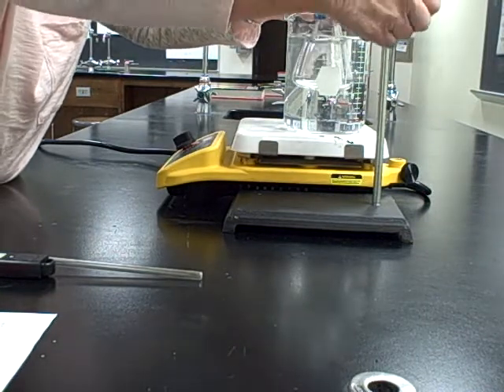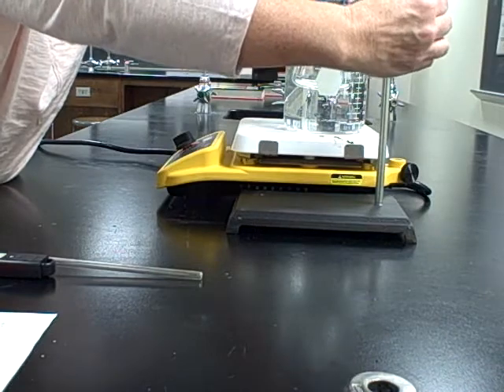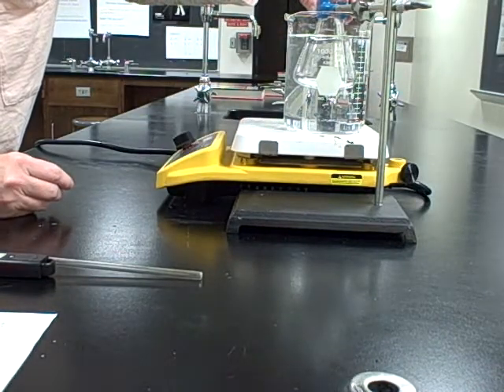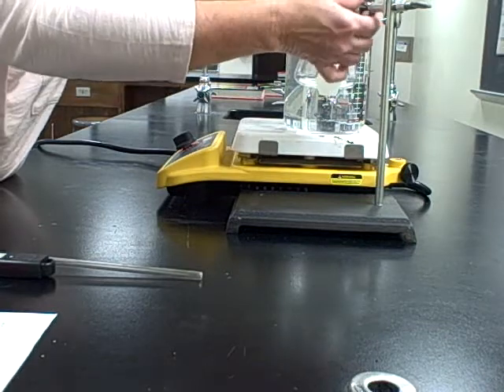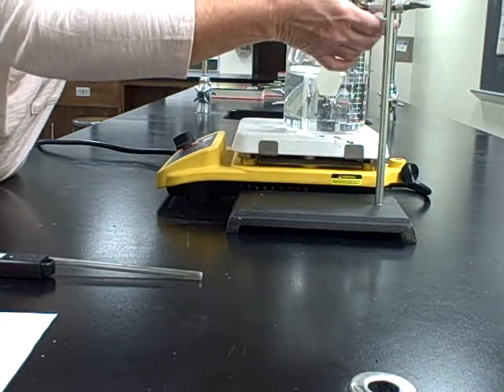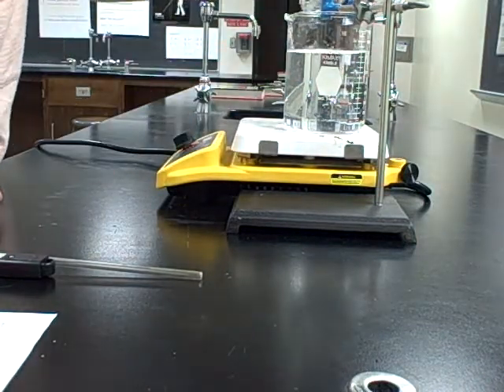And then I want to drop this down as far as possible. So I'll drop it down to there when I'm ready to clasp it in, and then I'll go ahead and tighten it up here. So that looks like pretty good positioning. Open it up so I can take the flask out for now.